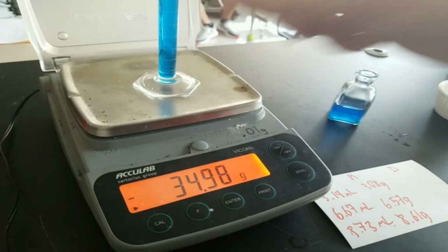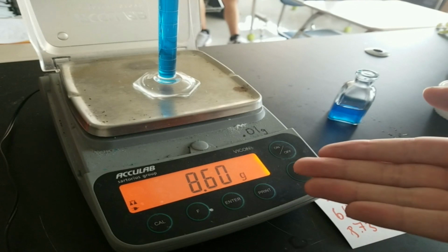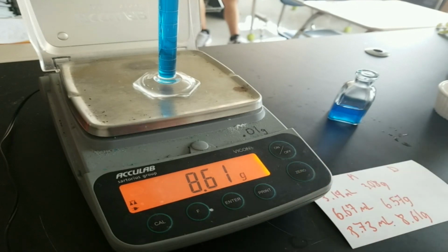That's an error. Now, since those droplets are there, they will not increase volume. They will increase mass, which means density goes up. This is the sort of thinking you want to do when you have an error. Now, being that there are not that many droplets, this would probably be a minor error, meaning not a huge deal, but still need to record it and have it down. You'll also notice the scale occasionally shifts. That is because the scales tend to be very sensitive. Whatever number sticks around the longest is the number you record.